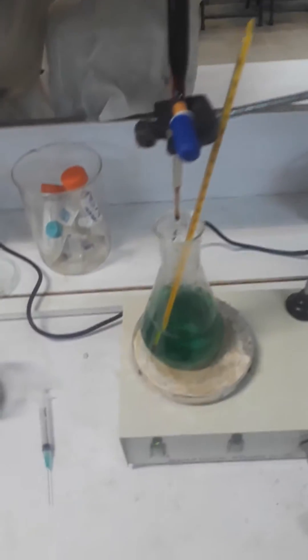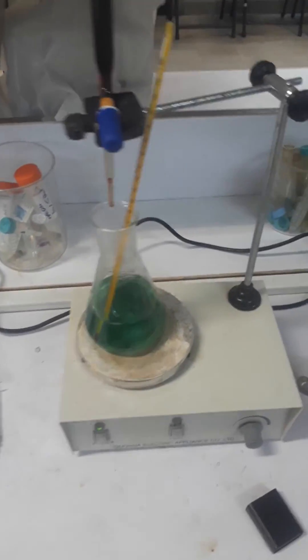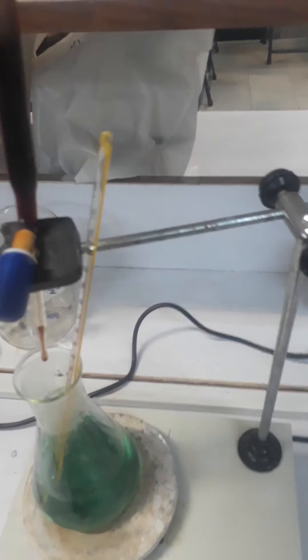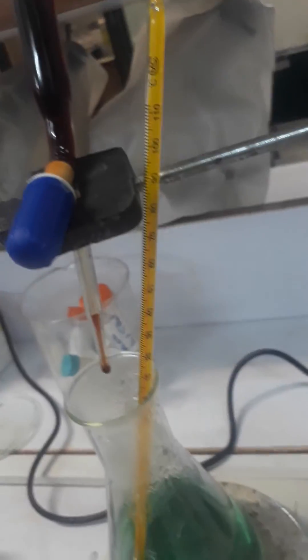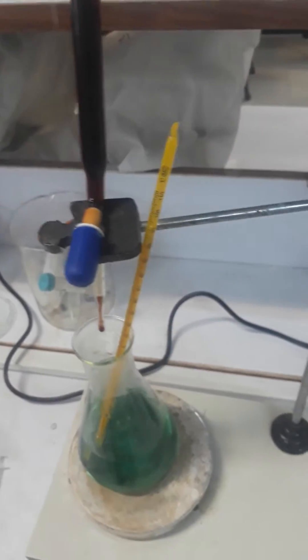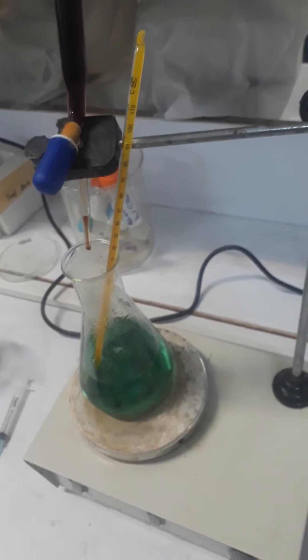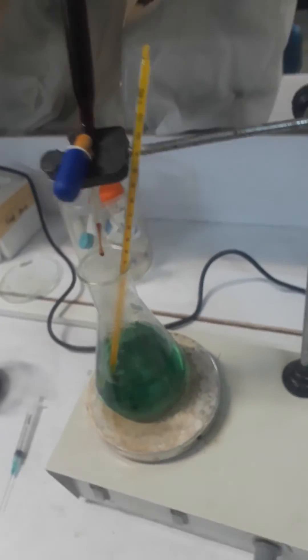And the main thing is your temperature. As you guys can see over here, I'm maintaining my temperature at around 80 degrees and I'm making sure that the titration goes very slow, because the slower your titration is, the smaller your nanoparticle is.